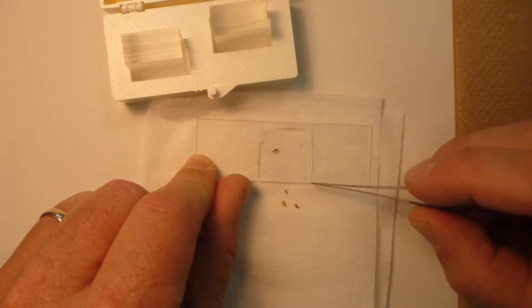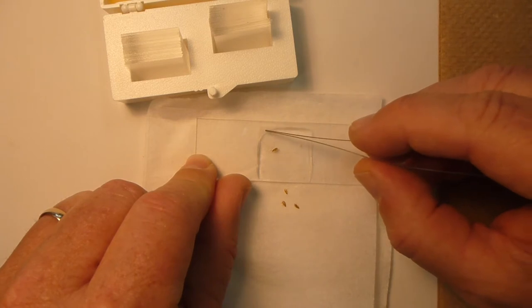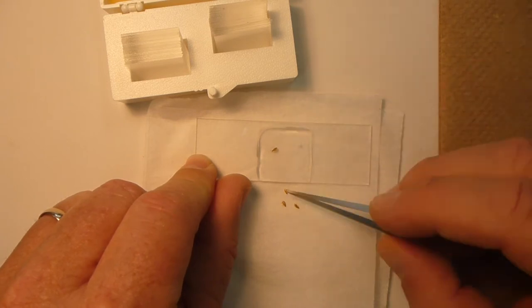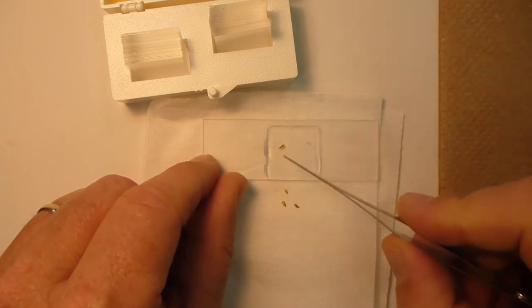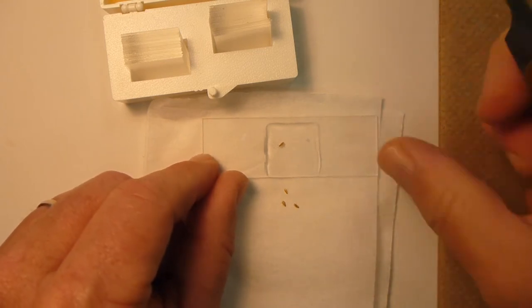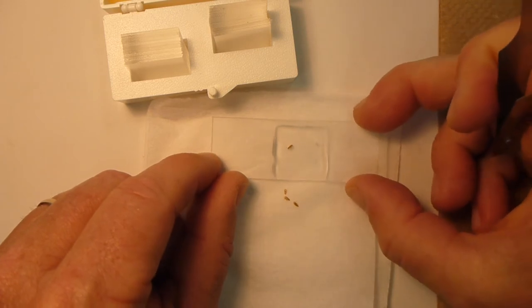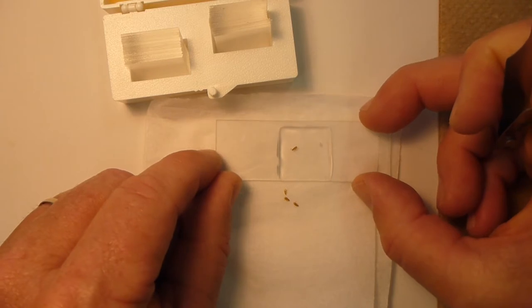Then just let the coverslip slowly wick that excess material until the entire coverslip, until the specimen is in there. You can see the specimen has moved to the upper left of the area, but yet the specimen is still visible. It will be clearly visible when we look through a microscope at it.